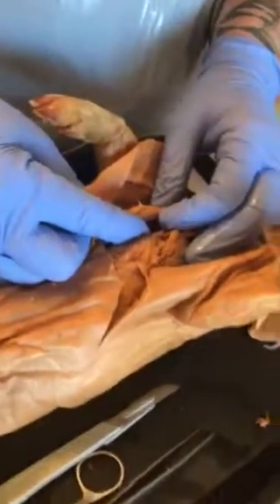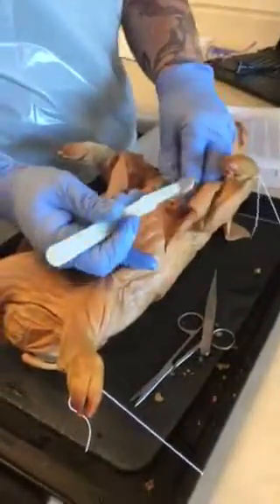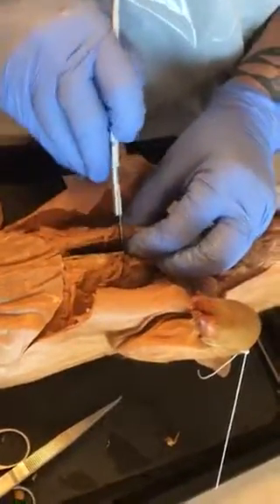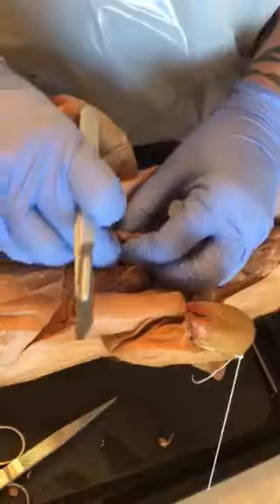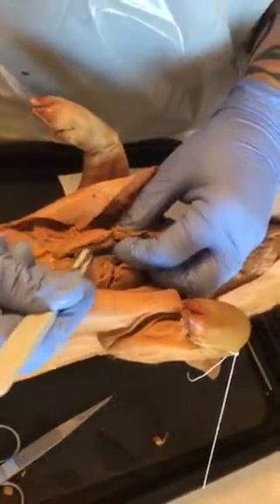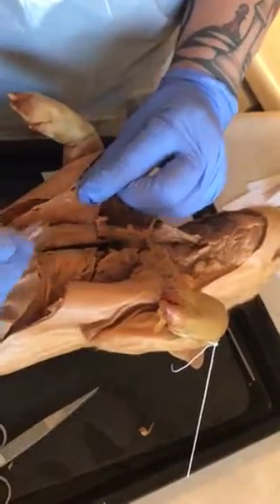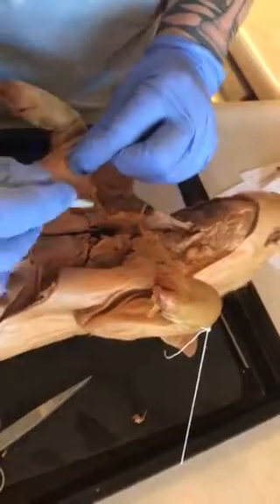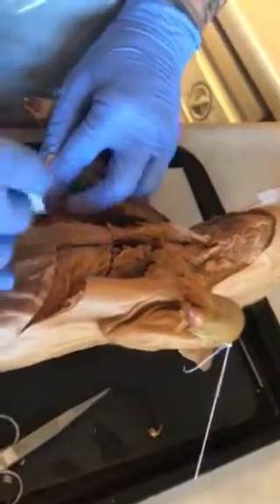Let's see, make multiple cuts between ribs on both sides and pull those pieces back individually. Okay, so each rib, we're gonna cut that back. Okay, so there's 1. And where's the other one? Gotta feel. Cut away some of this muscle tissue so we can get to the actual rib cavity.